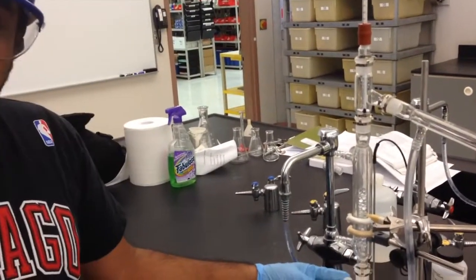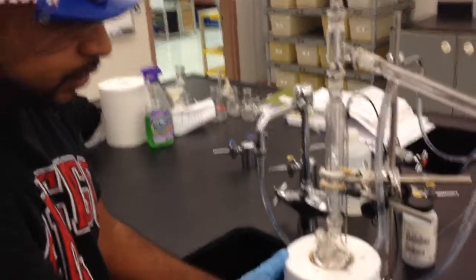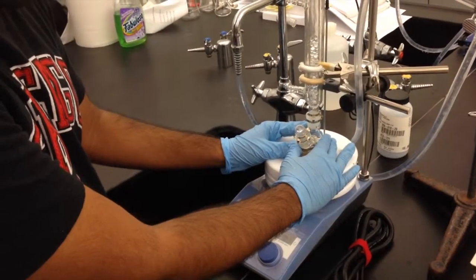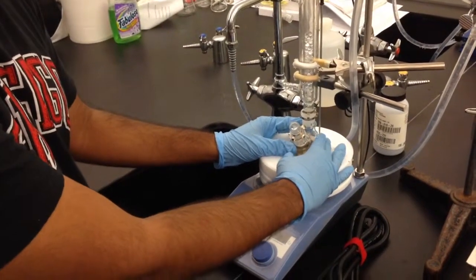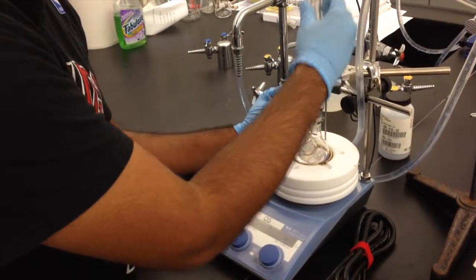Now just go through the apparatus just like the simple one. You have your heating element right here, same as a simple distillation. You have your round bottom flask where you actually put your compound in to heat up. Now in our case, we're using toluene and cyclohexane. We have, now this is our fractional column. Now this is what's different between our simple distillation and fractional distillation.